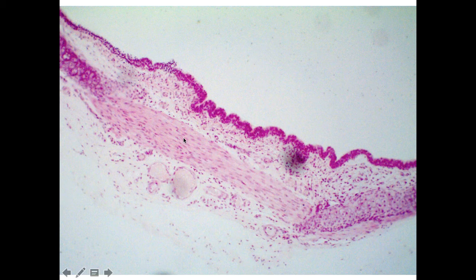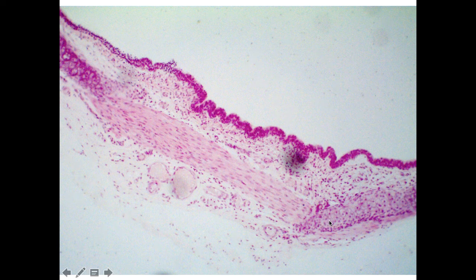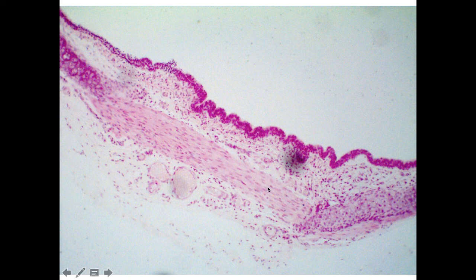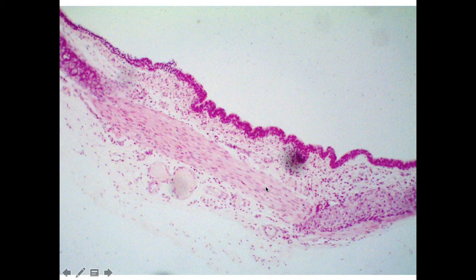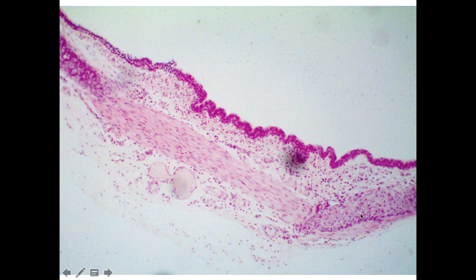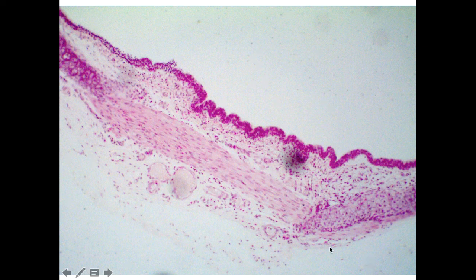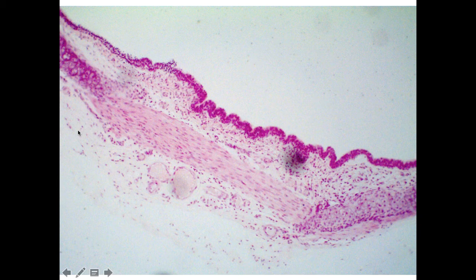Here is a nice example of the trachealis muscle. Between the two points — the ends of the C-shaped cartilage — the region is filled with this trachealis muscle, the smooth muscle layer that helps change the diameter of the lumen, perhaps during coughing. The trachealis muscle shows the classic smooth muscle appearance: spindle-shaped cells with a nice central nucleus. It occupies the same layer as the cartilage, but only on the posterior side. Finally, the adventitia layer embeds the trachea in surrounding connective tissue.